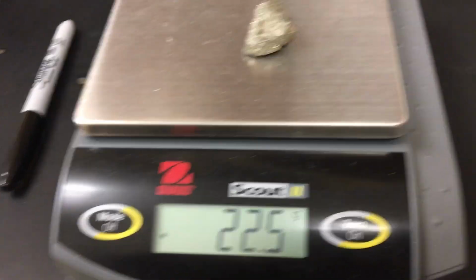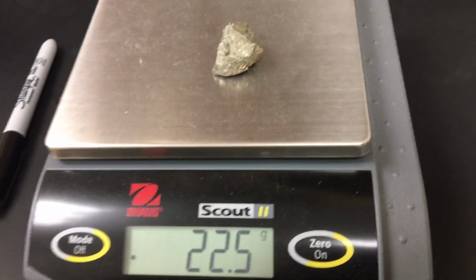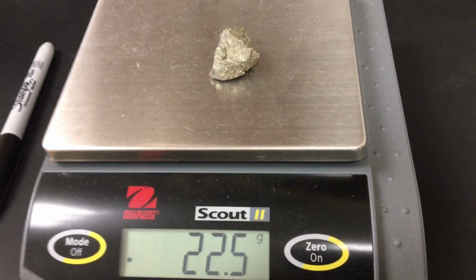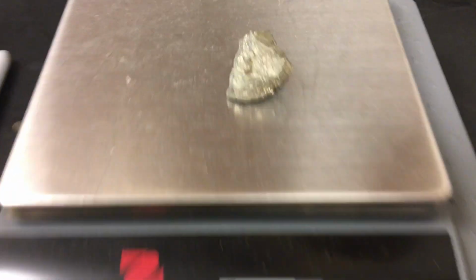And then I'm going to give you the mass, and you're going to have to try to tell me the volume. You know what I'll do too? I'll figure it out after the video's over, and then we'll see how close you got. All right, so there's your mass. You're going to figure out what the volume of that rock would be, what that mineral would be. This is a mineral called pyrite or fool's gold.